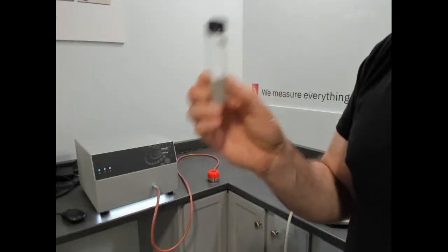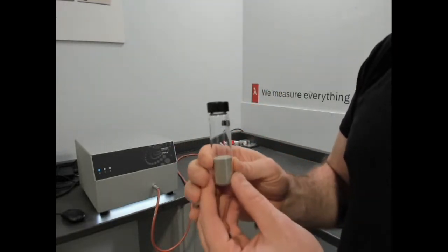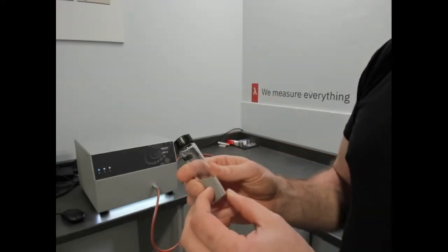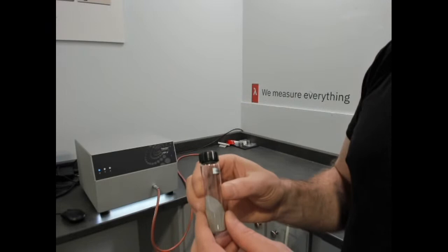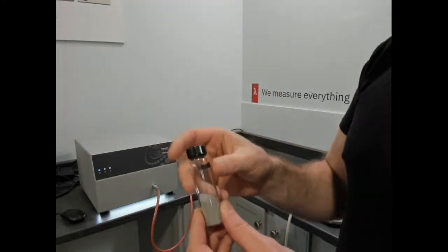I don't know the exact particle size of this titanium powder, but it's sub 1,000 micron, spherical in shape. Why I'm pointing out that it's spherical in shape is that you'll see when you're testing it in various setup situations, even with change in force or density or pressure, the number's pretty stable.